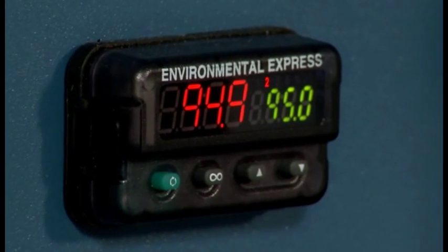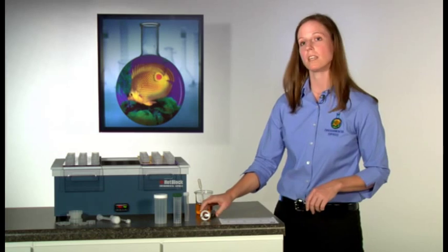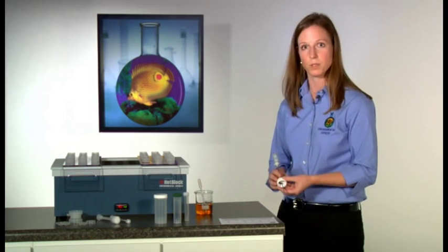Now set the block to the temperature called for in your method, keeping in mind that the block temperature will be slightly higher than that desired of your samples. This can be easily monitored by the available temperature probe.